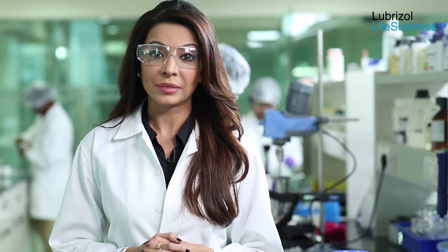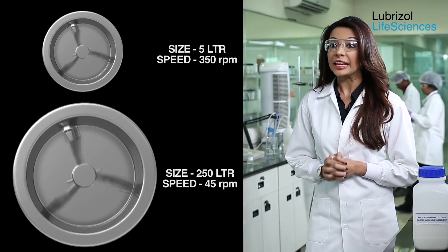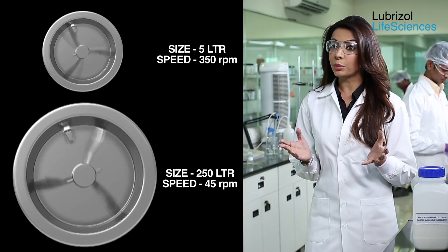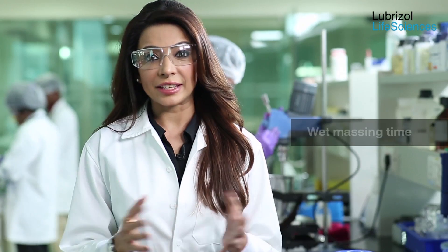Mixing speed: the impeller speed should be sufficiently high to facilitate fast and uniform distribution of the added water. The impeller speed is a function of the equipment size. When changing the equipment, the tip speed rule must be used to calculate the impeller speed. For example, a linear tip speed of 2.5 meters per second achieved at 350 rpm in a 5-liter bowl corresponds to 45 rpm in 250-liter equipment.